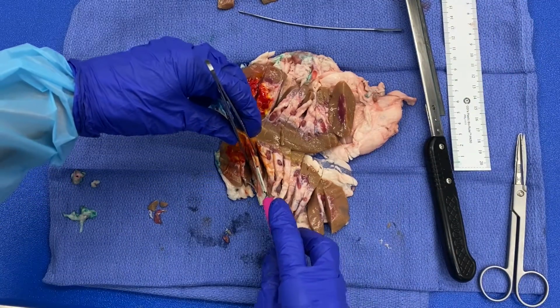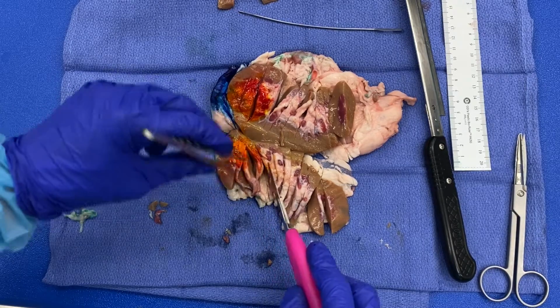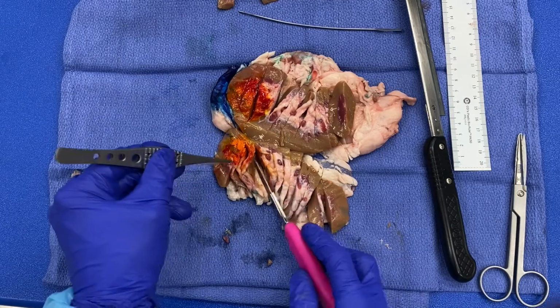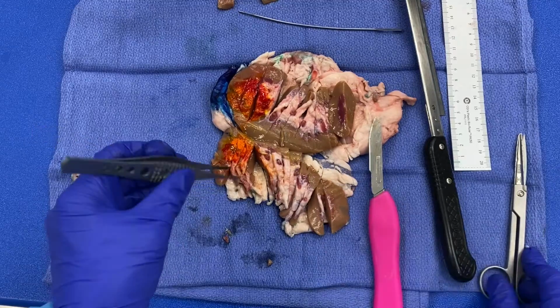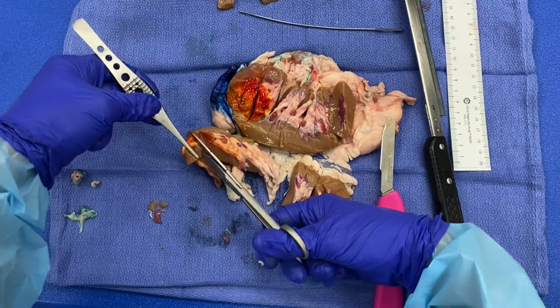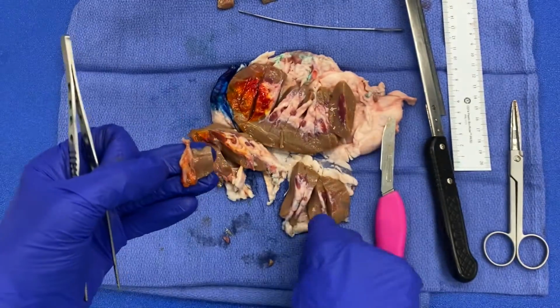Okay, so I am going to go ahead and sample right here because it looks like it's really approaching that renal sinus fat and urothelial mucosa here. Remember, renal sinus fat invasion is associated with a poorer prognosis, as is perinephric fat invasion. However, it is thought that perhaps renal sinus fat invasion is a poorer prognosis than perinephric. So it is important to document which fat the tumor is invading and be specific in your descriptions. So now I have my tumor in relationship to my renal sinus fat.